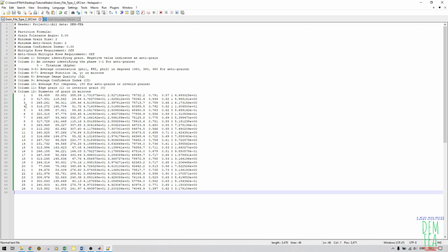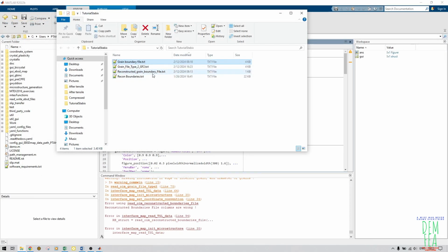As you can see, you have 1 to 12. If you count these columns, you have 1, 2, 3, 4, 5, 6, 7, 8, 9, 10, 11, and 12. So that's okay. That's no problem. That one is taken care of. Very easy peasy.